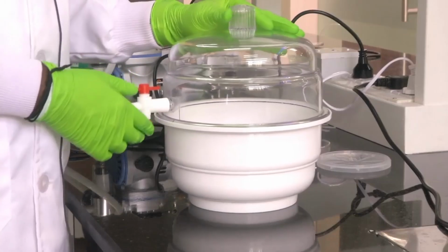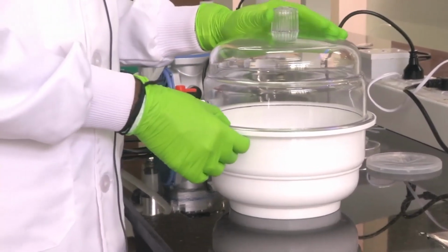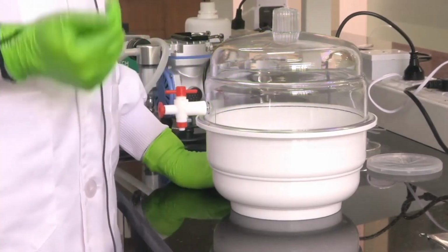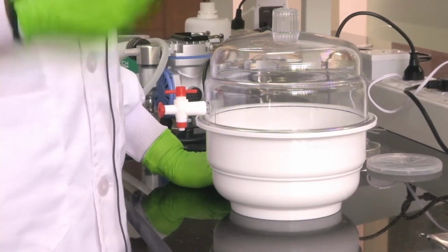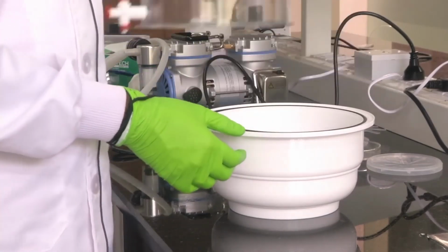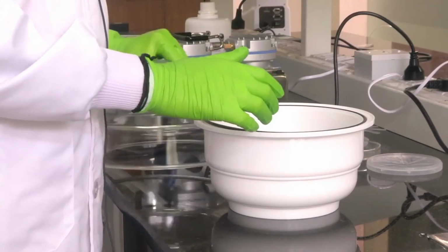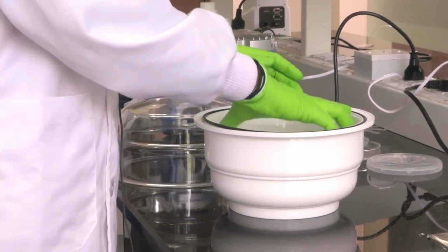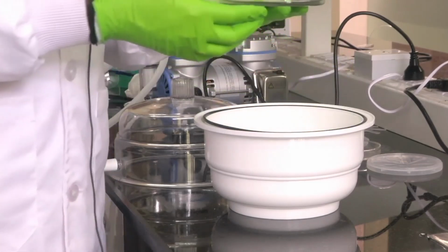So now we have performed the second round of desiccation for almost 10 minutes to remove the air bubbles that were formed again when we poured PDMS on the silicon master. Most of the air bubbles around the device are gone, and we have got a clear layer of PDMS on top of our silicon master. So this is what we are having.